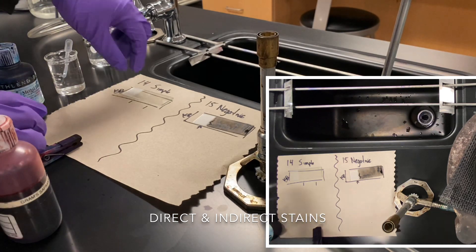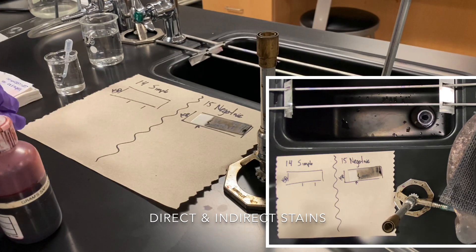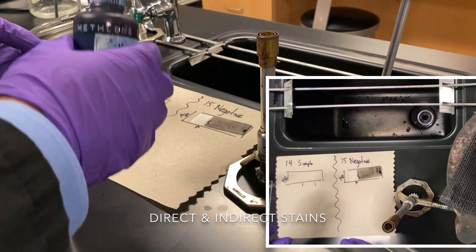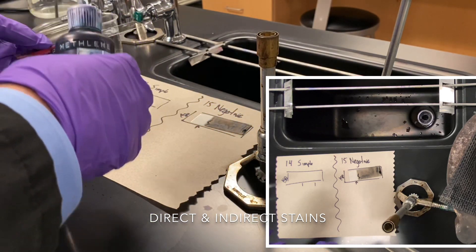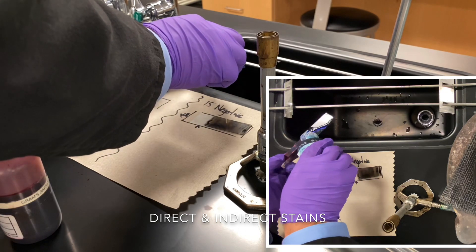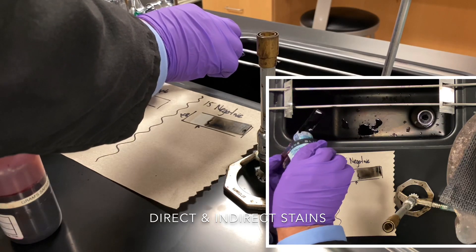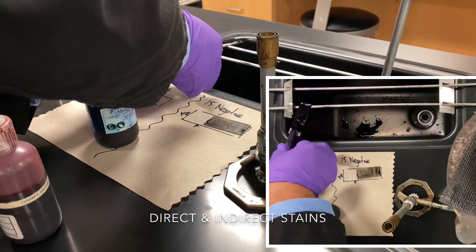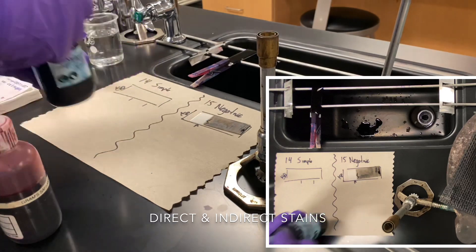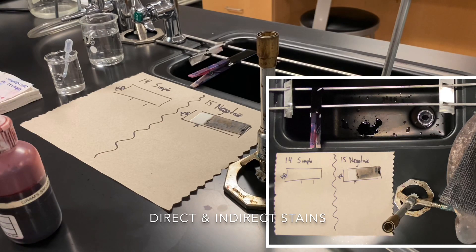The simple stain follows the same protocol as before — we're going to flood it. I'll prepare it using a hair clip and use methylene blue for the primary stain. It's a direct stain going straight to the sample, staining the actual cells. We'll carry out the waterfall process: place the slide over and pour just enough to flood the slide without wasting too much stain. We'll let it sit for one minute, just like most other stains, then close the stain bottle and clean up.